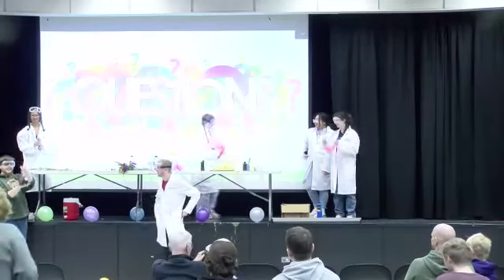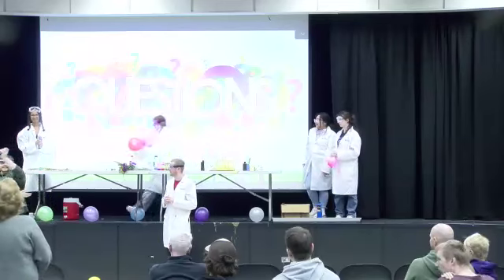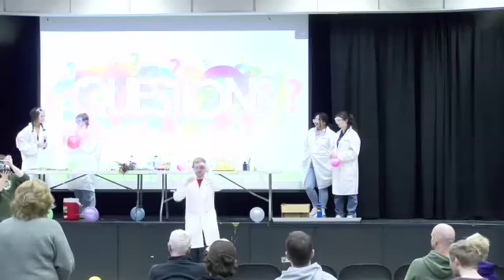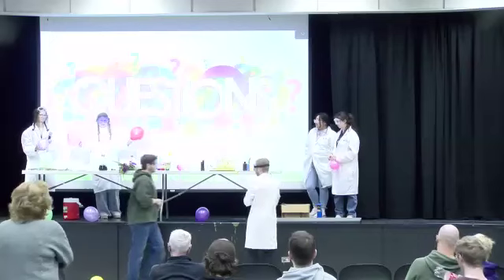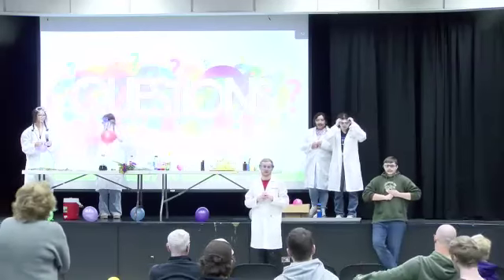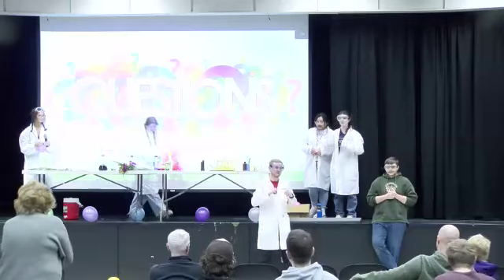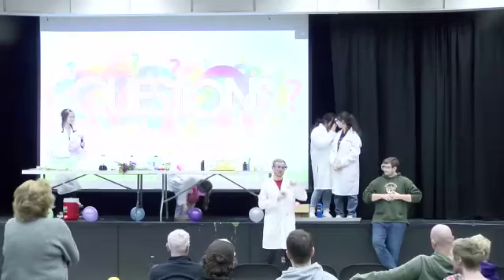Turning red, and then so if we shake this, they'll darken back up to green. Eventually, if you let this sit probably for an hour, it'll turn all the way. So, any questions right now? So, it's an oxidation of dye.